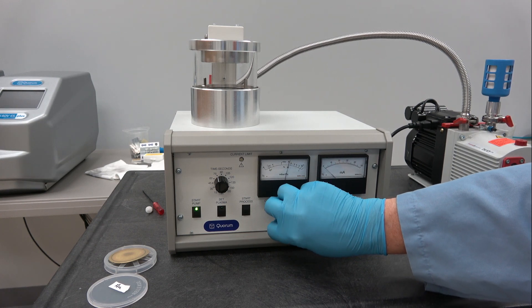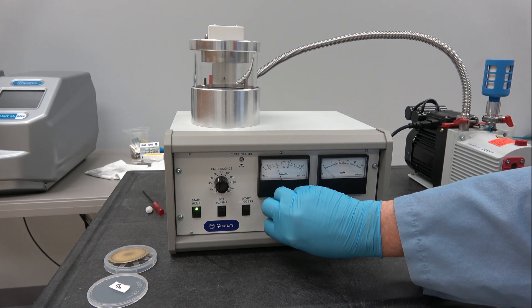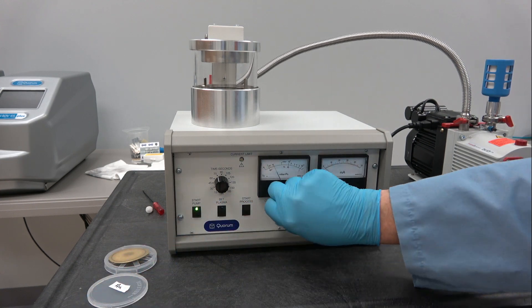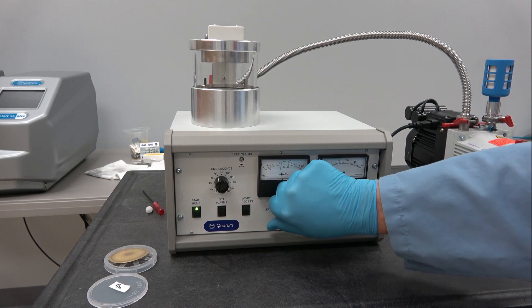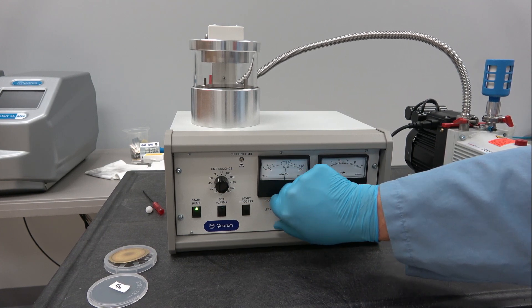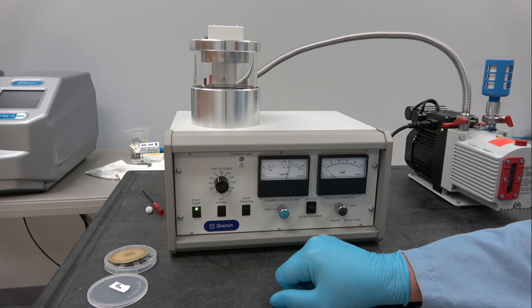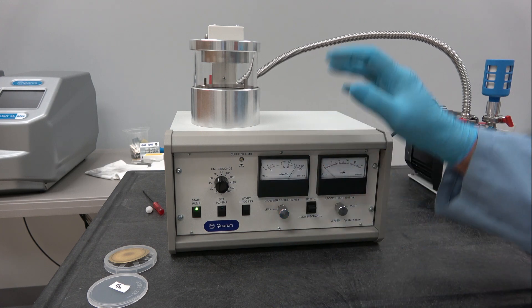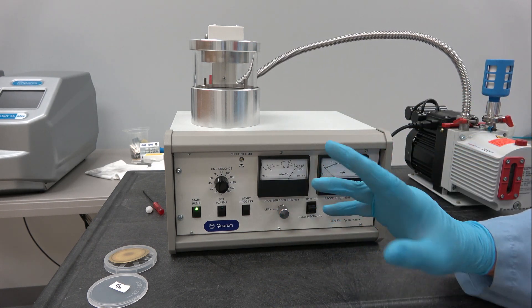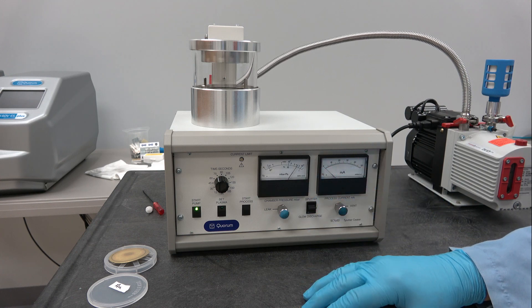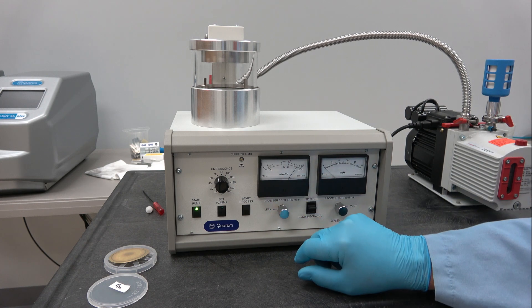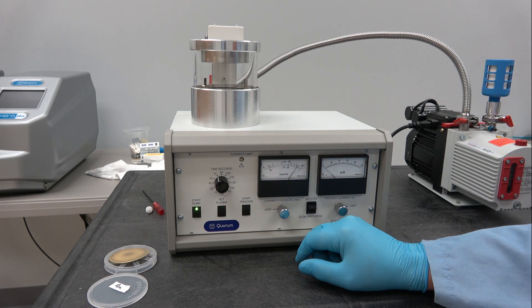However, I am going to purge just one more time. I might also add that the vacuum gauge is not calibrated to read argon. So you might have an error in reading when you vent the system because you're going to vent it with argon gas. It still might give you a reading where you have a vacuum left in the chamber when you really don't.